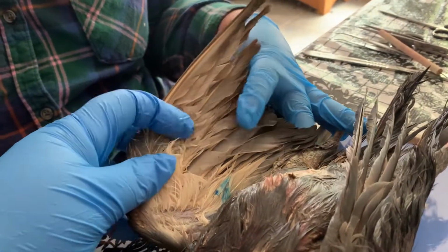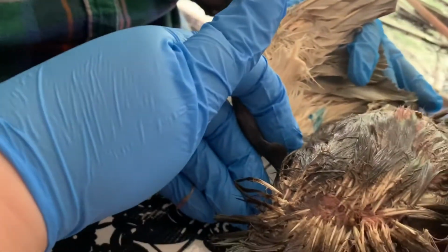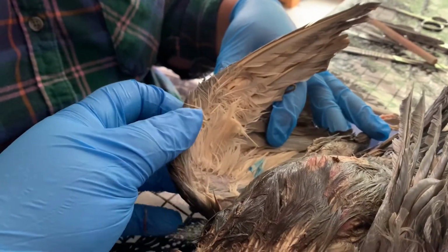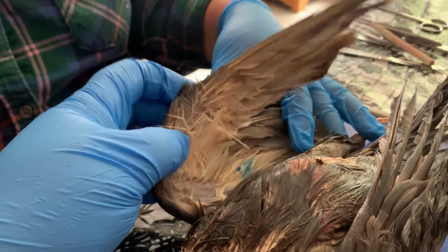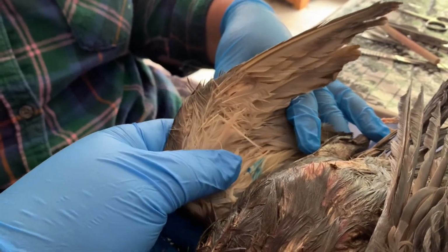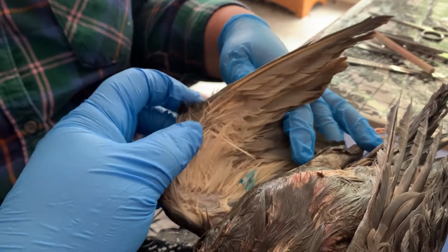These primary feathers are also called the flight feathers. We also have these shorter secondary feathers right here. These are actually attached to the ulna, or the forearm bone. We've even got smaller scapular feathers right here. These are kind of like the shoulder feathers. All of these are flight feathers that are covered by these coverts. We also have alula feathers, which are kind of like the slots on the leading edge of airplane wings. These allow birds to slow down their flight.